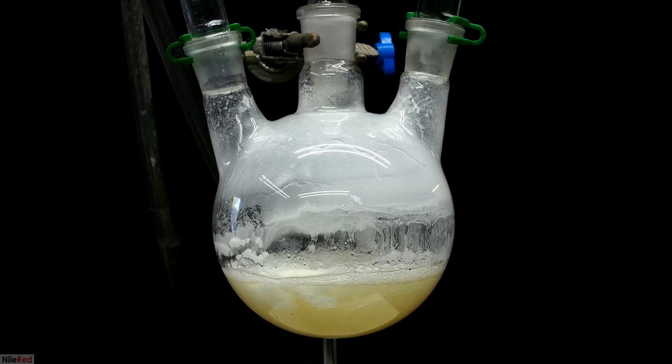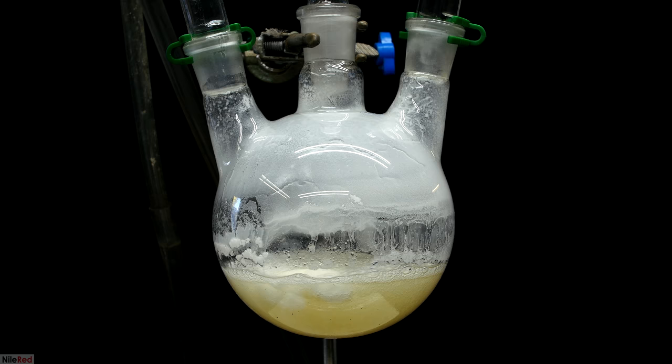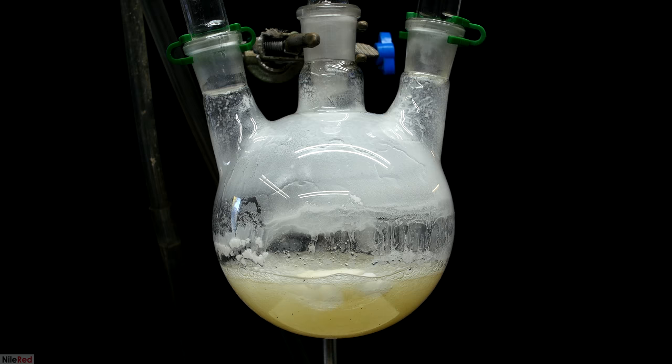Most of the paraformaldehyde and ammonium chloride has dissolved so it's a lot clearer here. There's also a lot of CO2 gas bubbling off which indicates that the reaction has started. As the reaction continued everything dissolved and I was left with a nice clear solution.